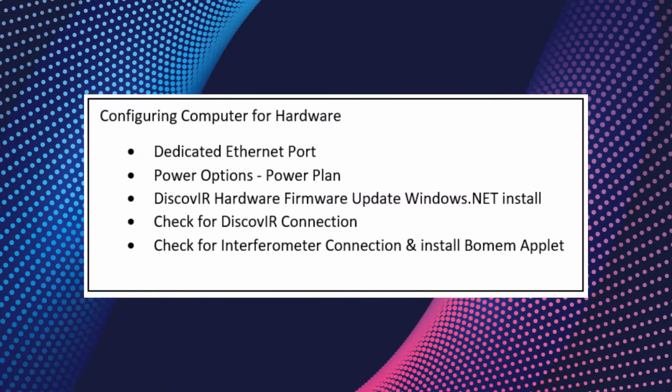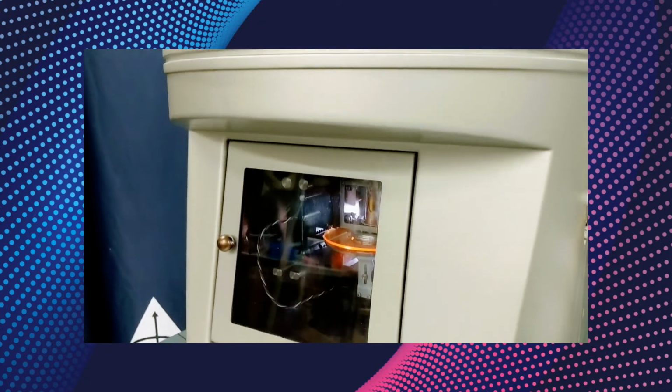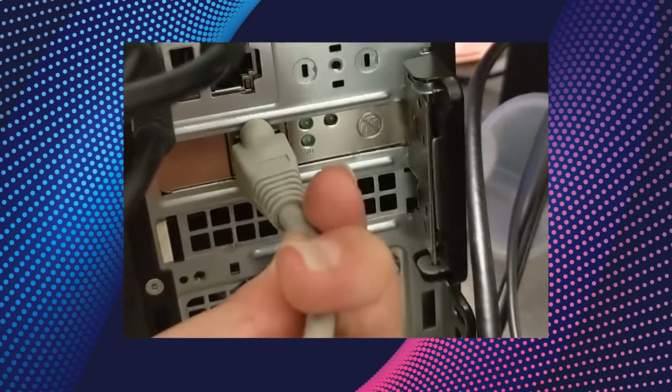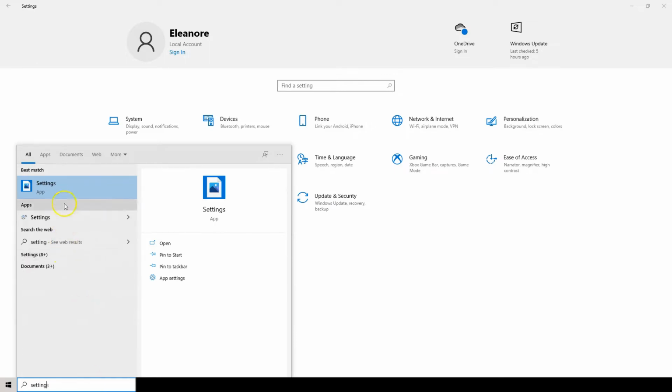DiscovIR10 is optimized for all Windows 10 systems. Unlike computers with companion licenses, the computer that will run Discover hardware will require a dedicated Ethernet port. If desired, an Ethernet plug-in card can be acquired and added to the computer to allow for multiple Ethernet ports into the computer. To set up the dedicated Ethernet port, go to the Settings page of the computer.